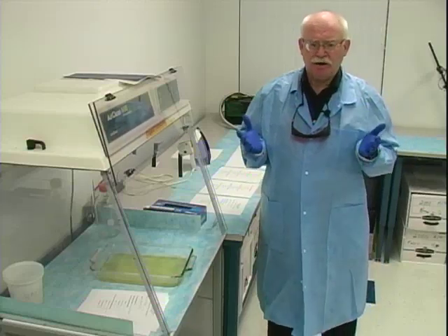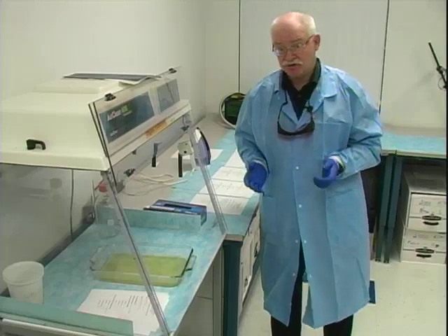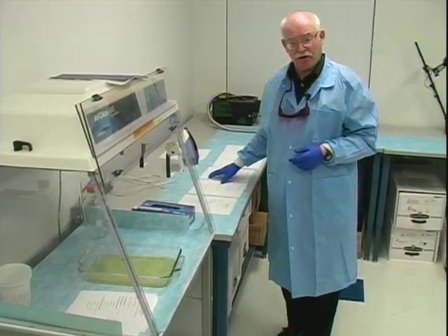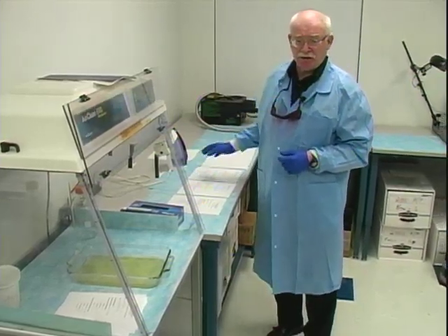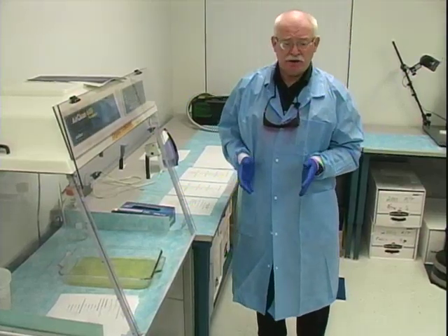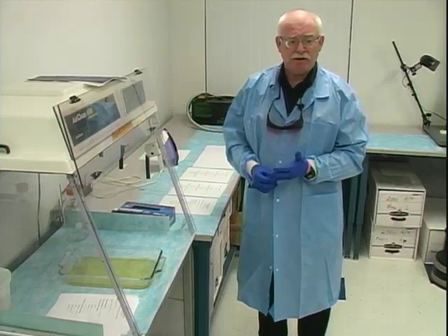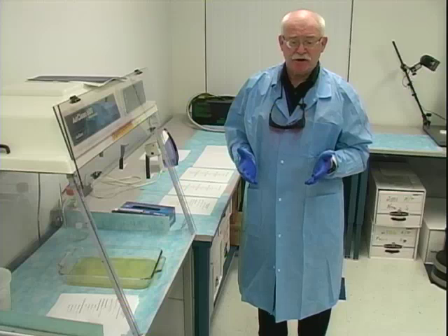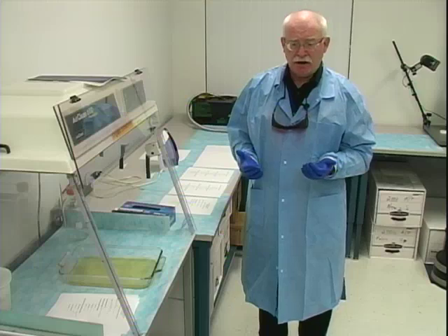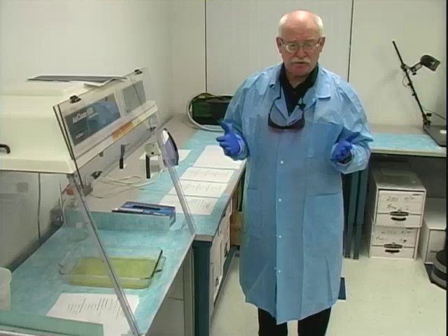The second stage of the process is to apply dry heat to the exhibits, making sure that they have completely air dried. The preferred and recommended dry heat is through either a dry mounting press or a t-shirt press — one that can be set for 160 degrees C and applies uniform heat to the entire surface.